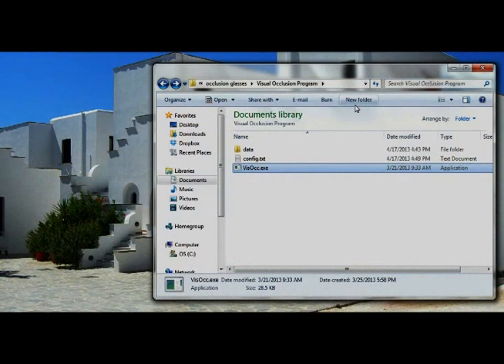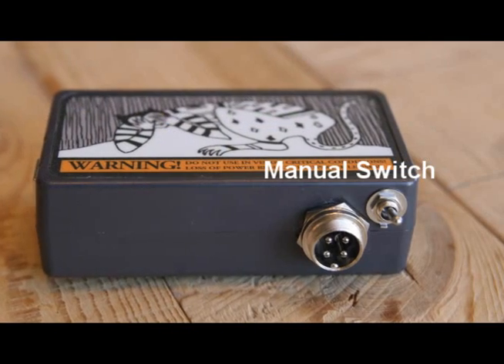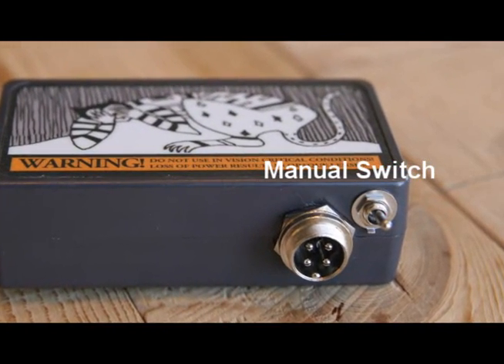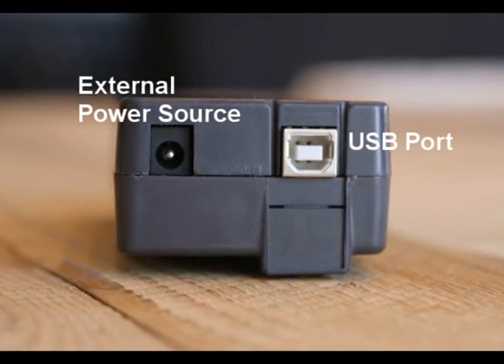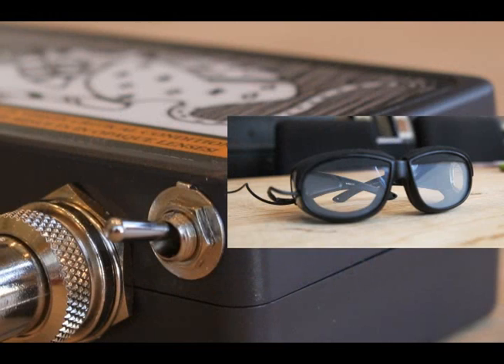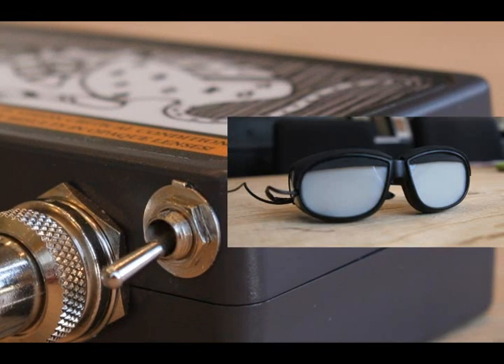If you don't want to use the program to control the glasses, there's always the option of doing it by hand. Each of the control boxes have a switch on the side, so you just have to plug the glasses into any power source, whether it's a computer or an outlet in the wall, and you go ahead and just flip the switch on and off manually to determine whether the glasses are open or closed.